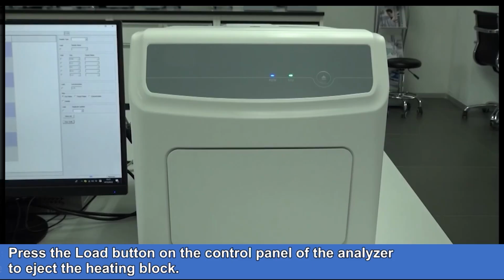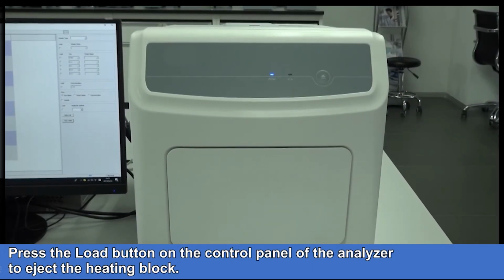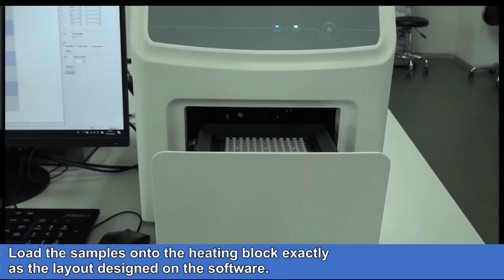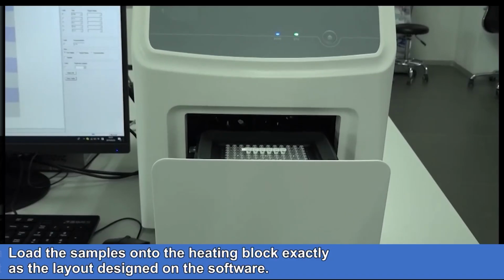Load the sample. Press the Load button on the control panel of the analyzer to eject the heating block. Load the samples onto the heating block exactly as the layout designed in the software.